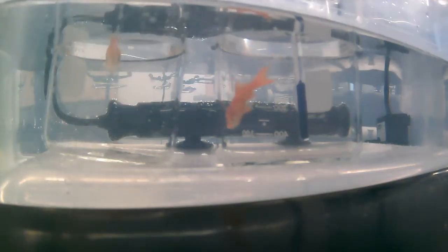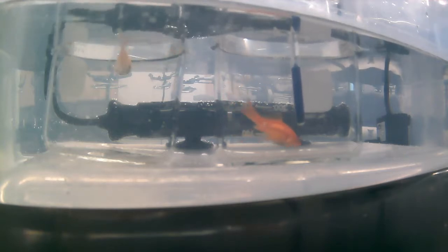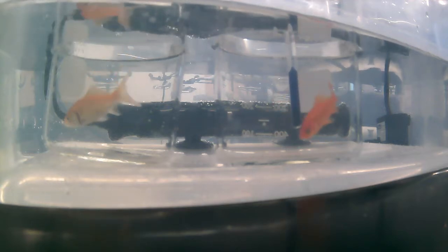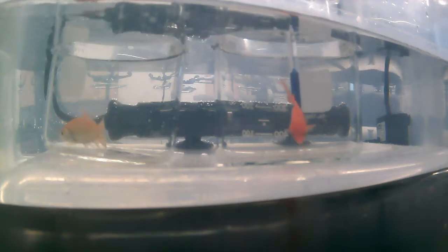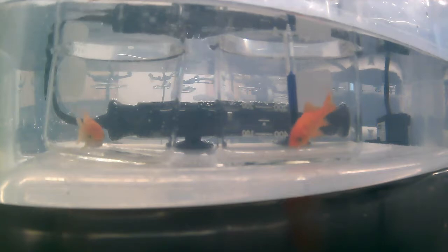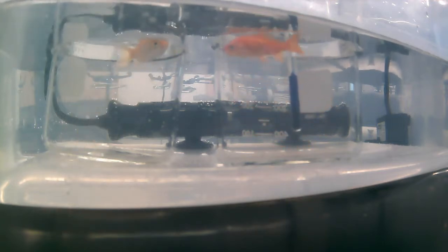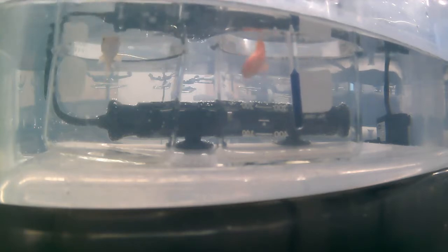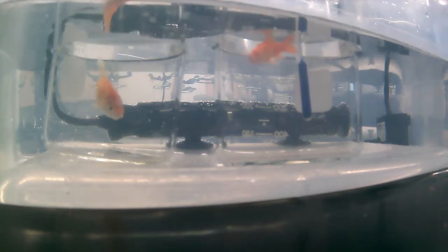Okay, so now you can see that the goldfish are much more agitated. You can see the respiratory rate's gone up precipitously. Both fish are showing initial stages of loss of equilibrium, trying to swim down to the bottom, and their air bladder, or swim bladder, which is not at the center of gravity, tends to work against them as they lose muscular control. So in a relatively short period of time here, we should be able to see loss of equilibrium.